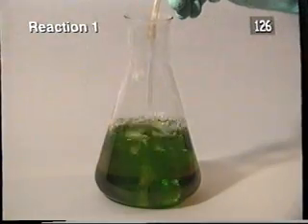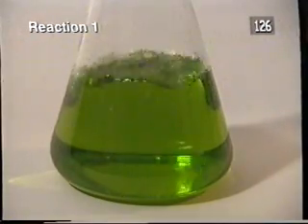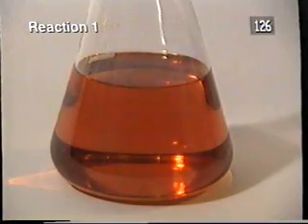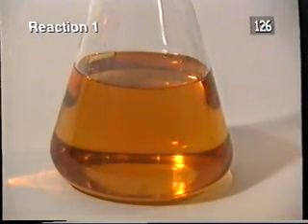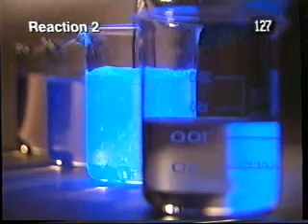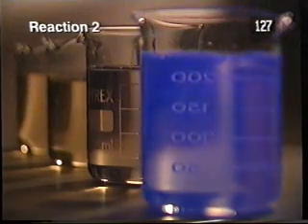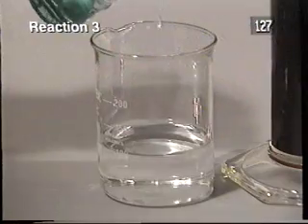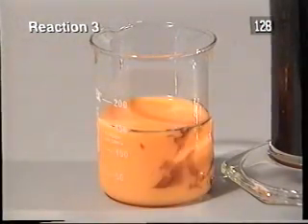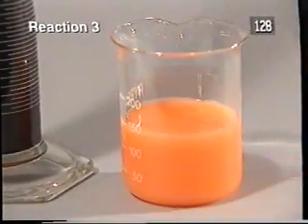As oxygen was bubbled through the solution, it changed colour from yellow to red to green. On removing the oxygen, it went back again to red and then yellow. These reactions give out light. These reactions involved a colour change again, first to orange, then black. In the other flask, it occurred more slowly.